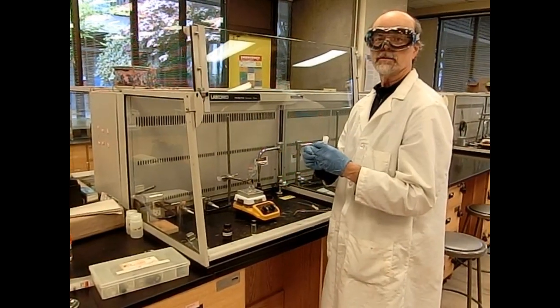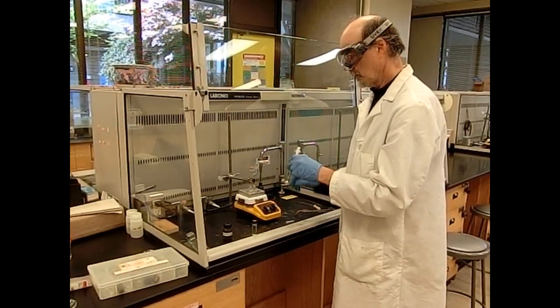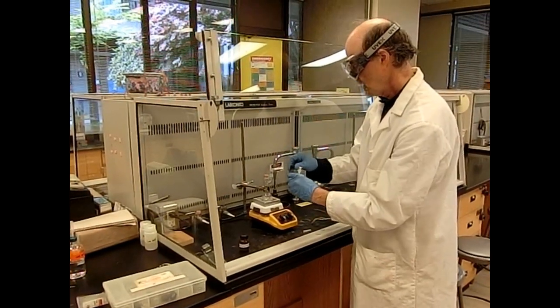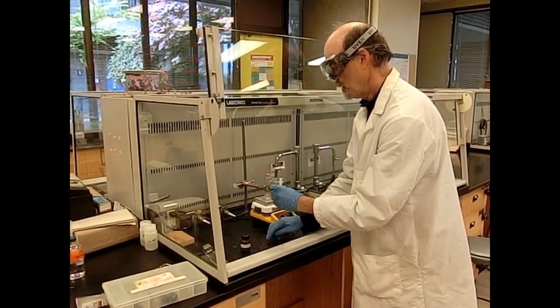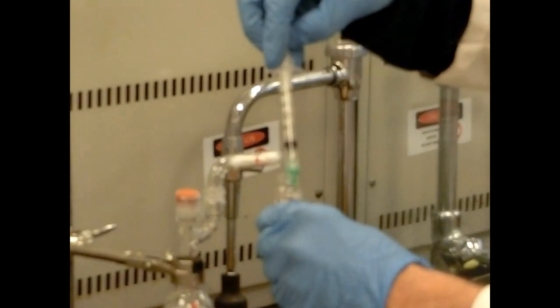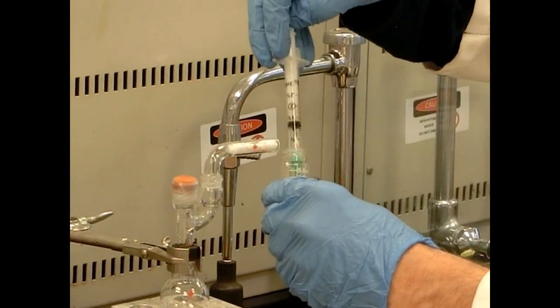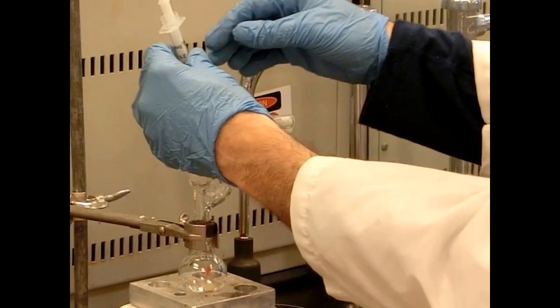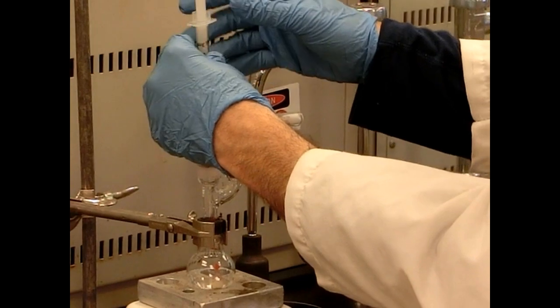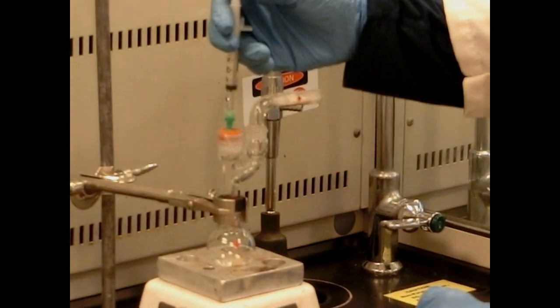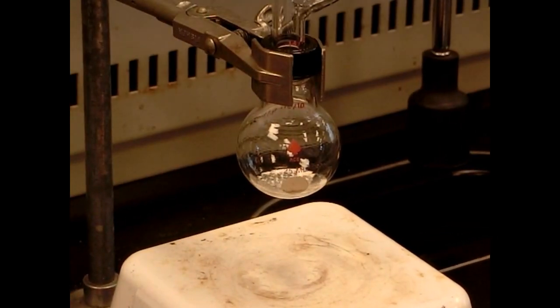All right, now we're ready to add our bromobenzene to our magnesium. We're going to add it using a syringe. This is our bromobenzene in ether solution. We're going to add this through the septum, and we'll be adding this solution throughout the experiment. We're going to first start off with adding about 1 mL of this solution, about a quarter of it to start with. Go through the top of the septum. And now we slowly drip our ether solution down to the magnesium. Start a very slow stir.